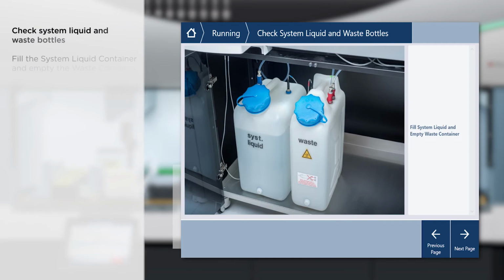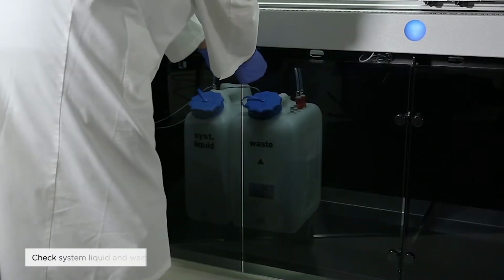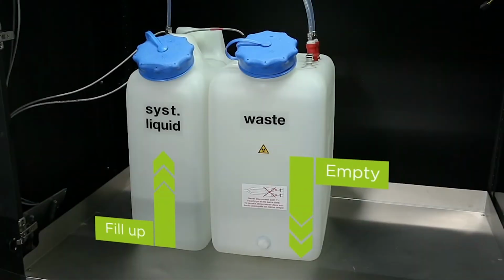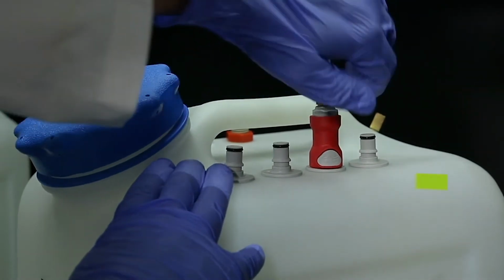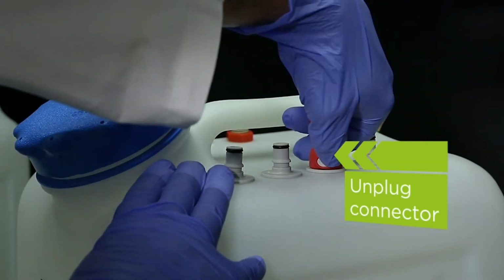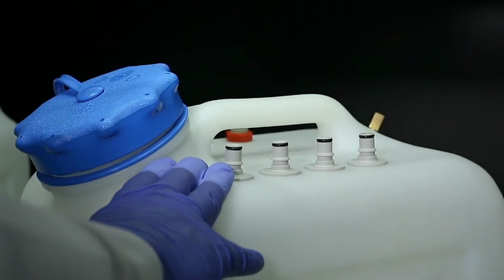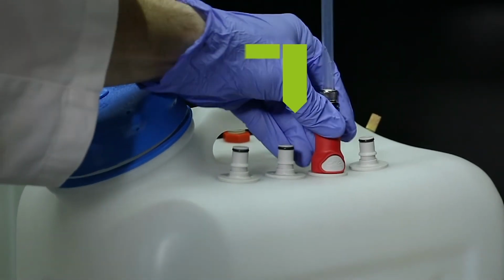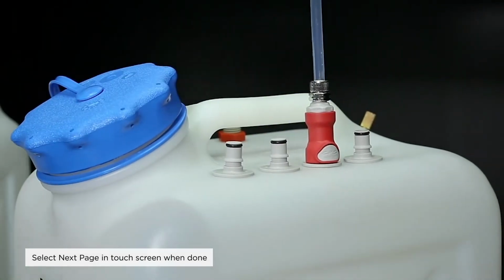Next, you need to fill the liquid system container and empty the waste container. Unplug the connector by pressing the button and pulling the connector upwards. To reconnect the connector, push it down until a distinct click is heard, and then select Next Page.